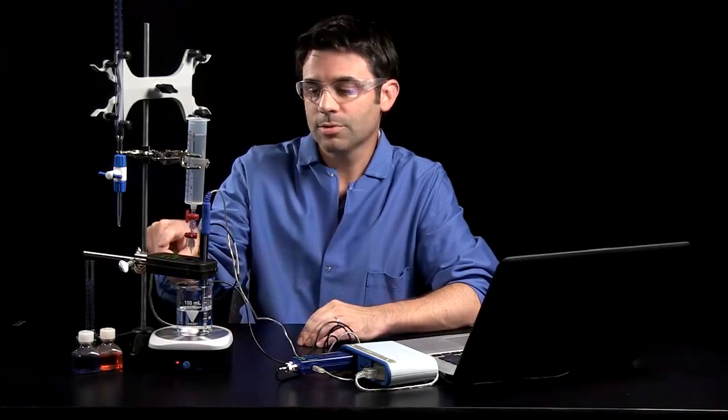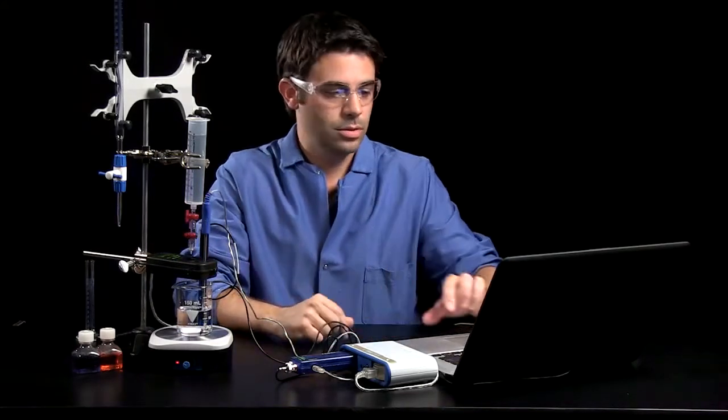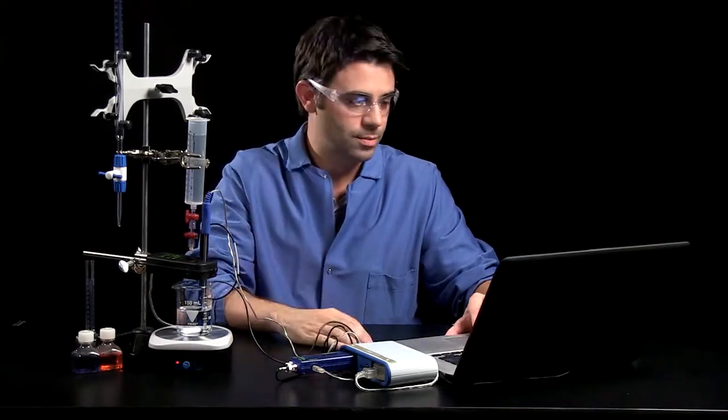The other nice thing about the drop counter is it tells me when drops are added, and I'm going to use my drop dispenser to add those drops. So let's start the data collection, and I'll show you how the drop dispenser works.